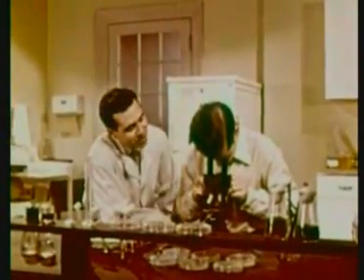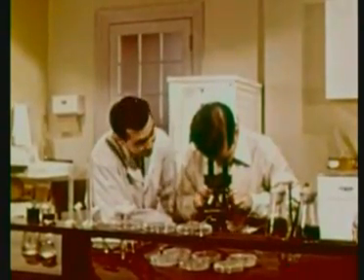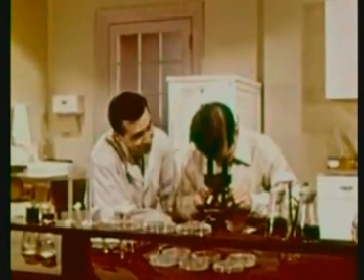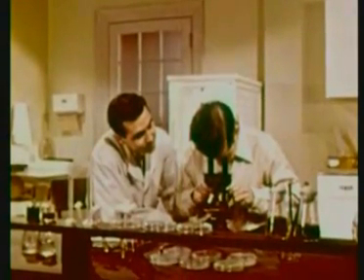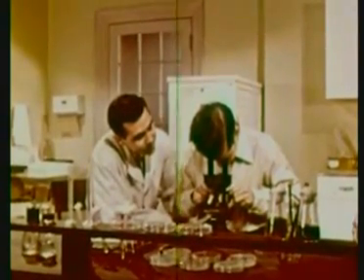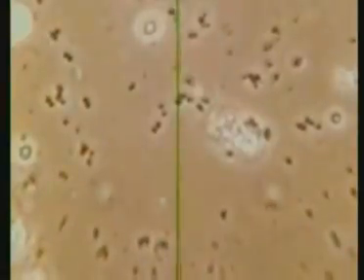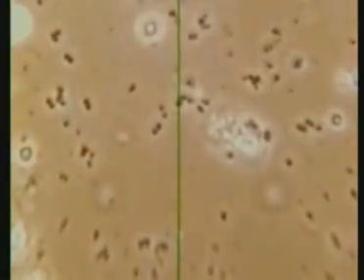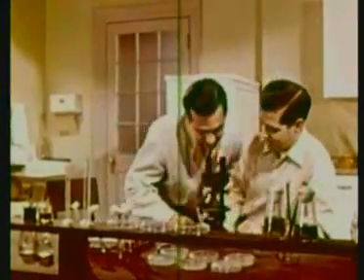Try using the fine adjustment knob. And do it more slowly. You're likely to miss the cells you're looking for, even though they may be there. Okay, I'm trying. Say, here they are. Here, look.